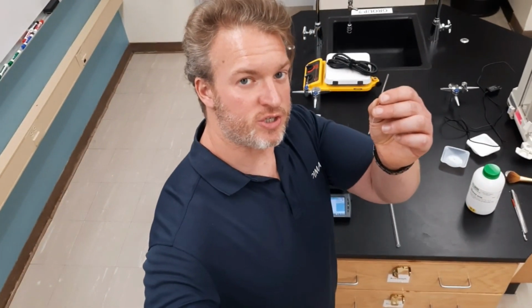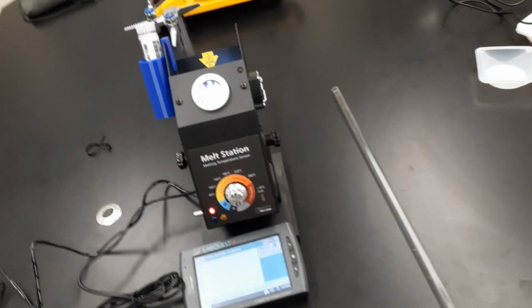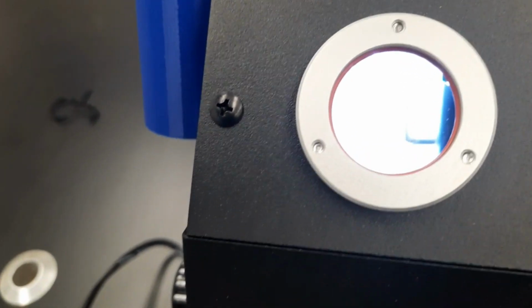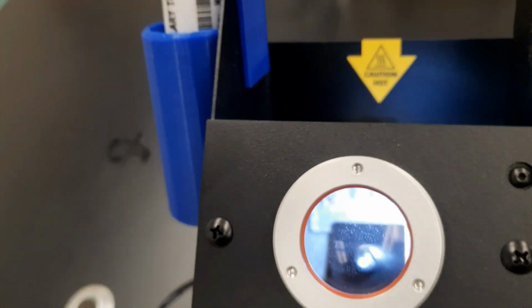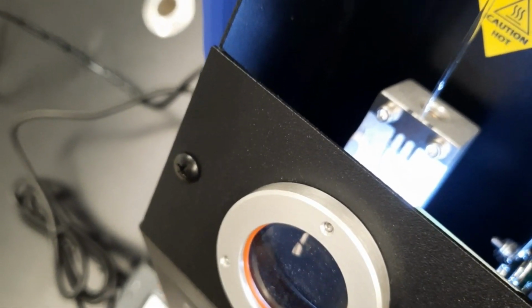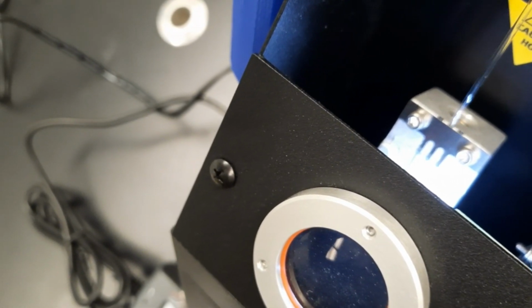Now I'll show you how to put your sample into the instrument and read it. So I want you to note that there is a magnifying glass right there. And if you can see inside of there, you should see some wells, like a metal block. You should definitely see a metal screw in there. Now, if you look up here, you see these slots? There's the middle slot, there's the left slot, and there's a slot on the right. I'm going to put this right in the middle slot.